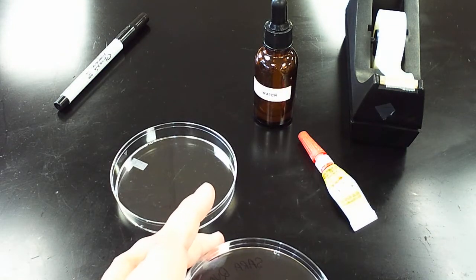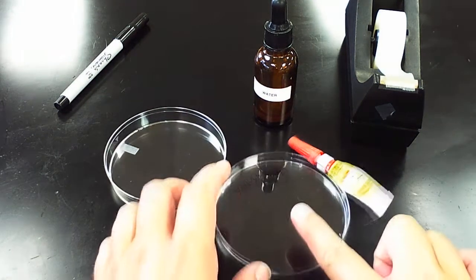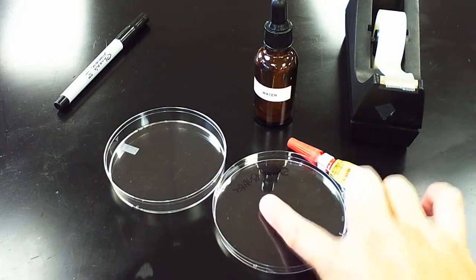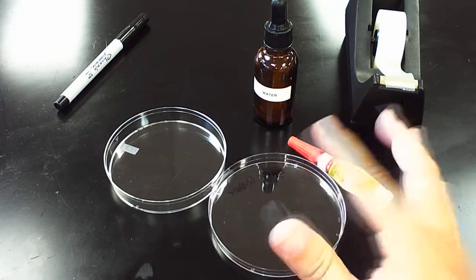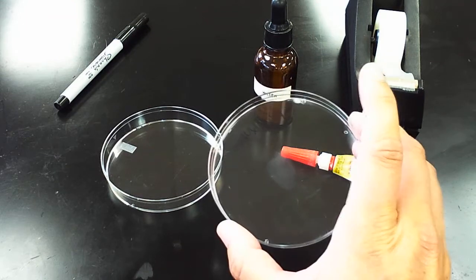I'm going to rub my finger on my face, like on my nose and forehead—believe it or not you have a lot of grease there—and then I'm going to really roll it and press it firm on the lid. You can even see a little bit of the fingerprint in the video.